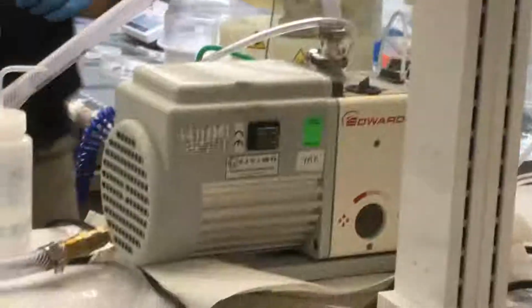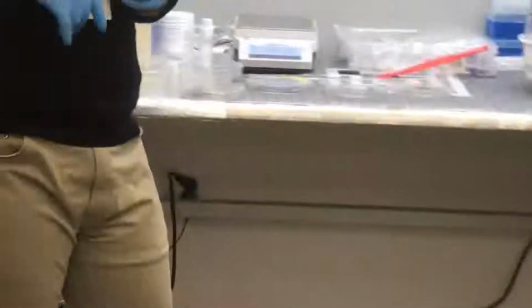Can I see how you do it? In this approach, it is open now. This is open. And when we want to close, we close it like this. Good. Then we turn on the pump. This is a switch. Just a switch, yes. This one. I turn it on. Now we should wait until all the air is gone. I think now we can stop.